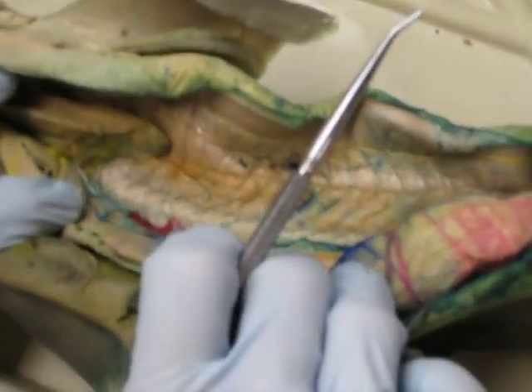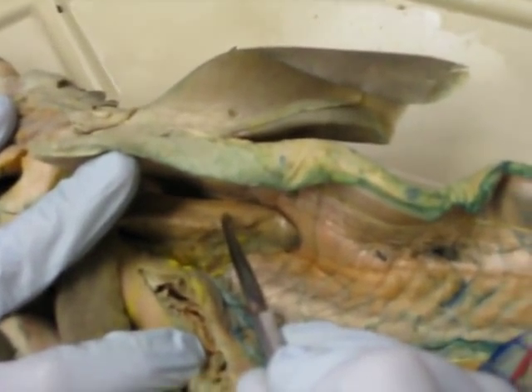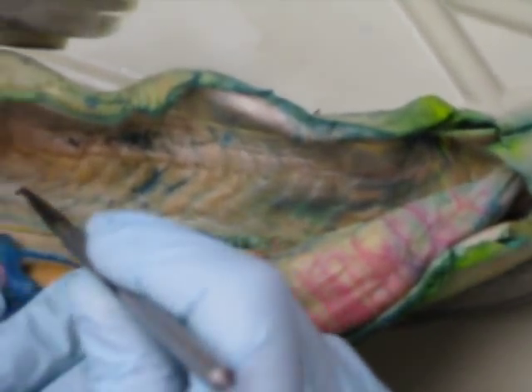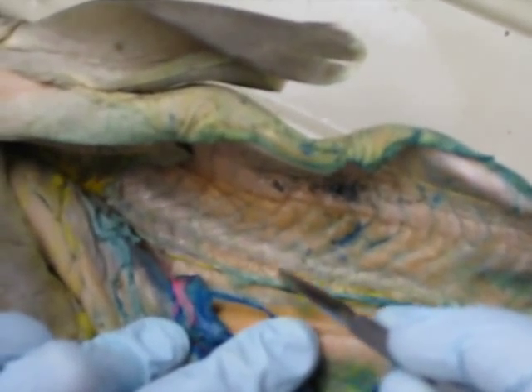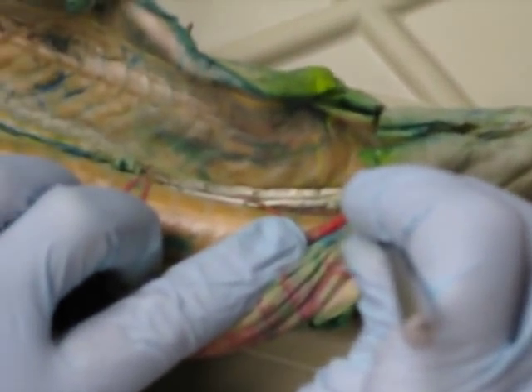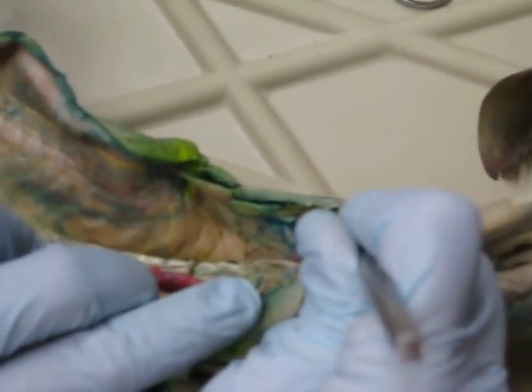This happens to be a little boy, and this is his testicle. So if you're ever attacked by a shark while surfing, don't kick it between the pelvic fins — it won't do any good. Here we can see the mesonephric kidney, and one thing you'll notice on these guys is the squiggly appearance of the mesonephric duct running through there. You won't see that with the female. Here we have it expanding out — those are the seminal vesicles. And of course here is the clasper, with a little swollen structure at the base which is the sperm sac.